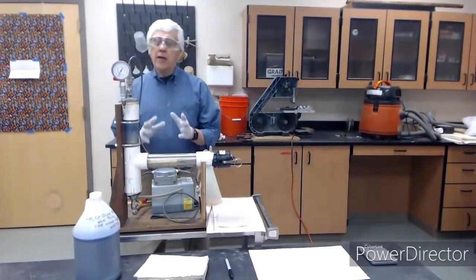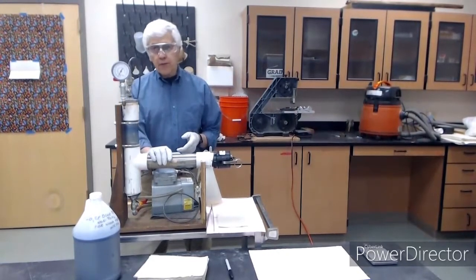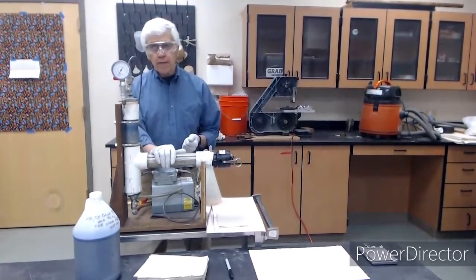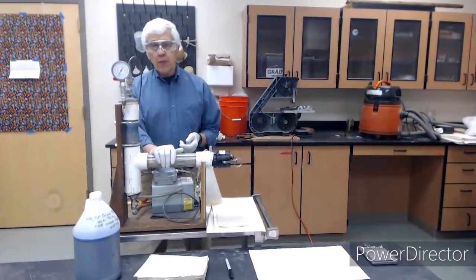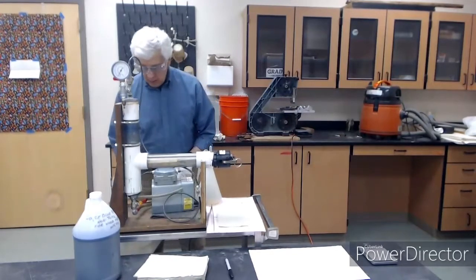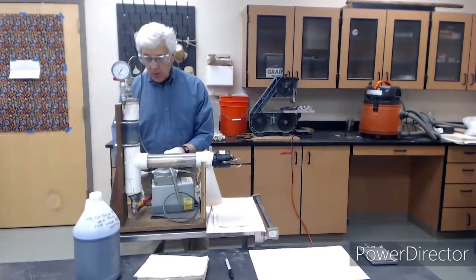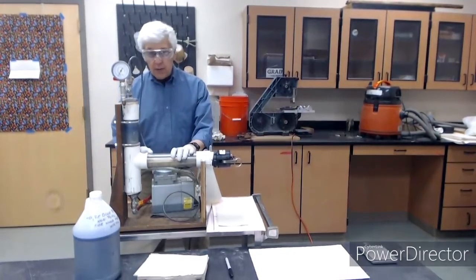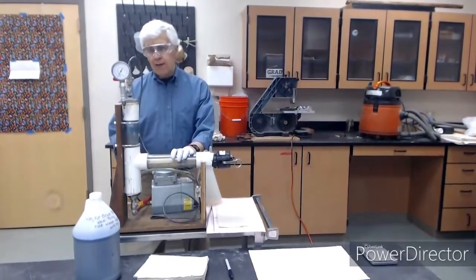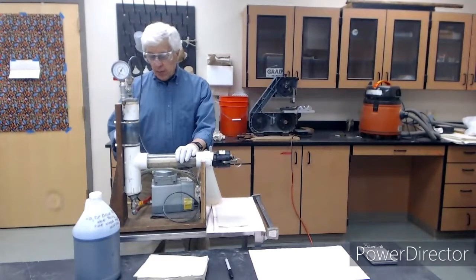Okay, so now we want to do an almost full cell treatment. The full cell treatment, you recall, is we pull an initial vacuum, then fill the cylinder with the treating fluid while we hold the vacuum. We're going to fill the cylinder by using this tubing into our storage tank. We open this valve while we have on a vacuum. It's going to fill up the cylinder, and it's going to fill up here in our gauge tank, although we're going to use the weights before and after instead of using the volume on a gauge tank, as they do in a commercial treating facility. So we'll bring it up here, close the valve, and we'll open.